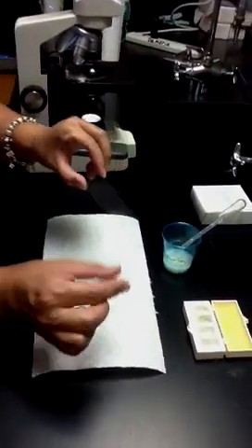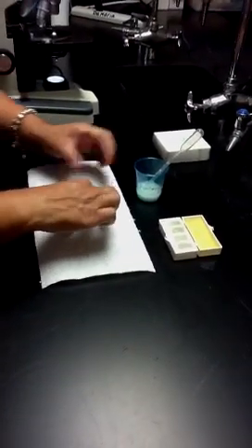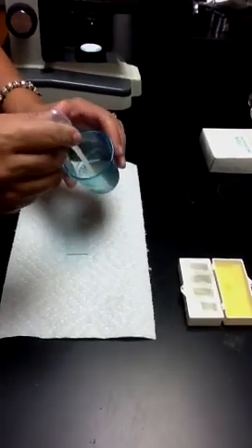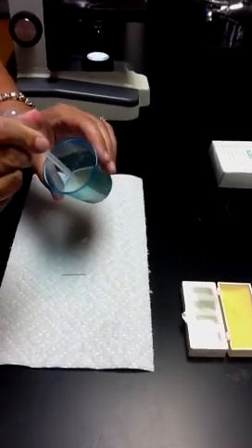I have a glass slide here and a glass cover slip, which you can probably barely see, and a little cup with some yeast, little brown grains of yeast, sprinkled into water.